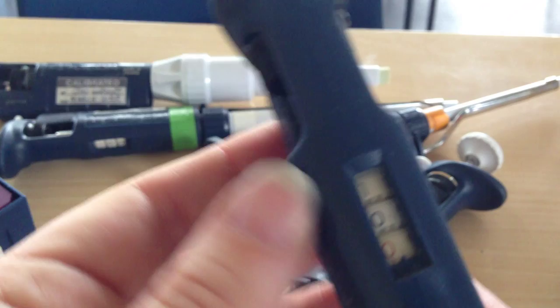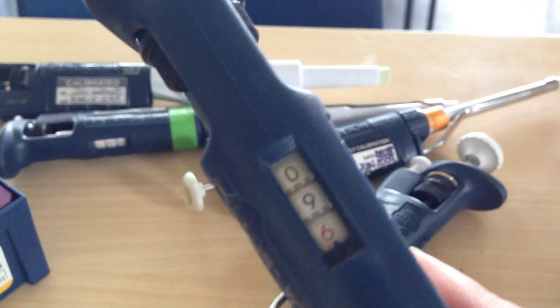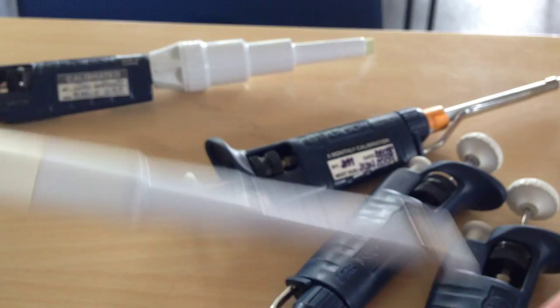It's a bit different on the smaller ones. You can see they have this red number at the bottom. So this is currently set to 10. That is 10 microliters exactly. If I change it to that that is 9.6 microliters. You can see this is getting quite specific here. Very accurate.